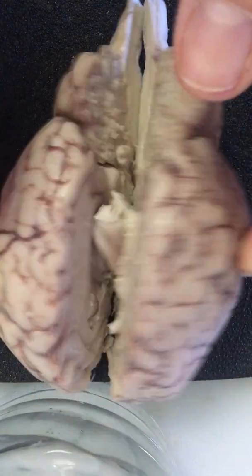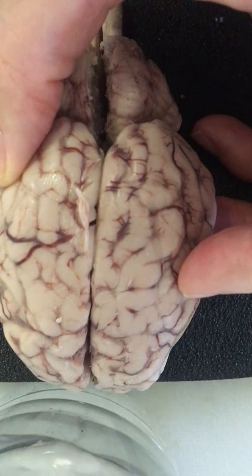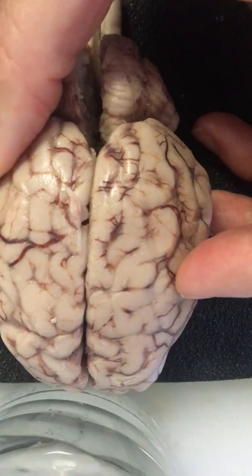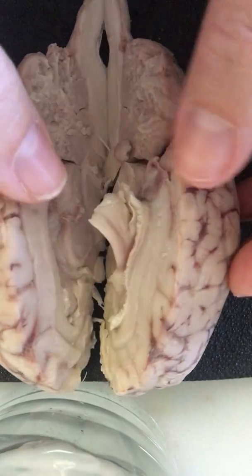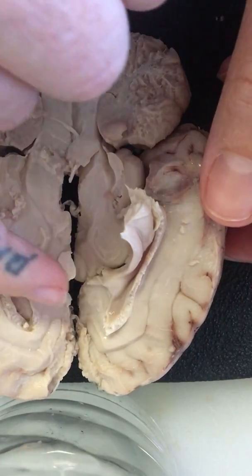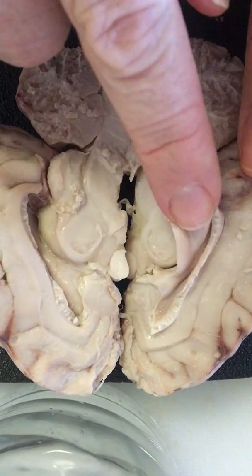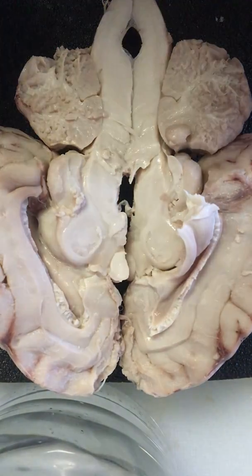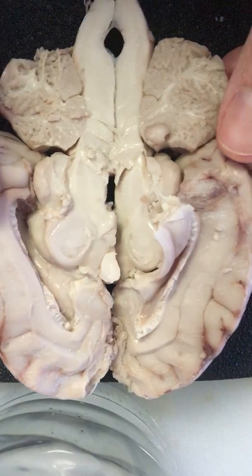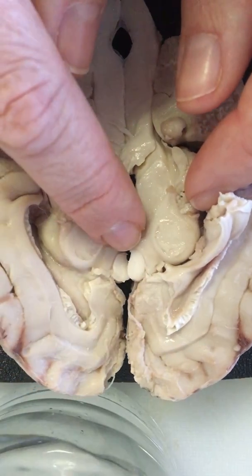What I didn't mention really quick is the 2 hemispheres. This is the longitudinal fissure that separates the right and the left parts of the brain, the hemispheres. And of course, inside, what connects the left and the right is the corpus callosum. This is how the left and the right communicate. This side's kind of coming up, but they are, of course, connected when the brain is intact. You can still see here the optic nerve on this end, and then here's the pituitary gland.